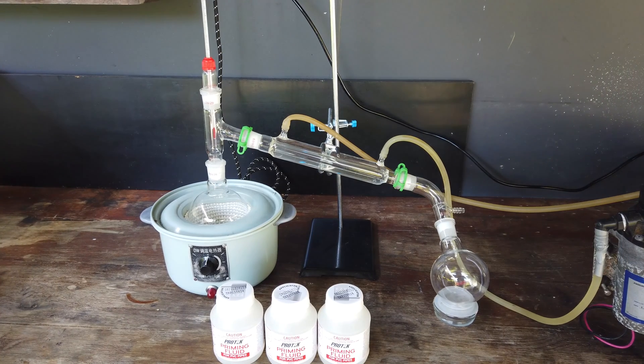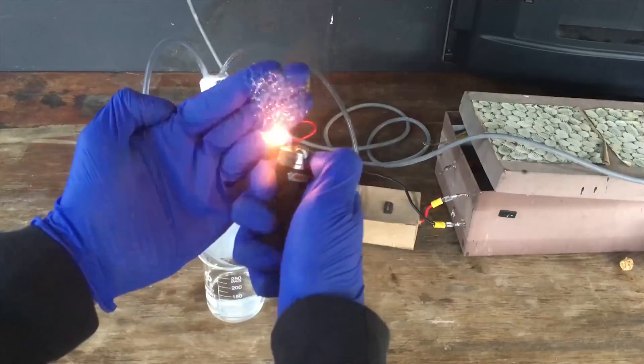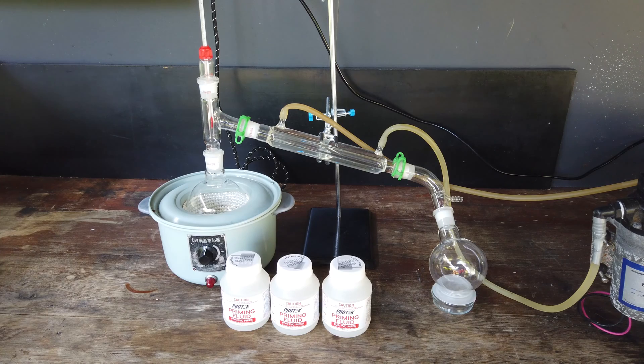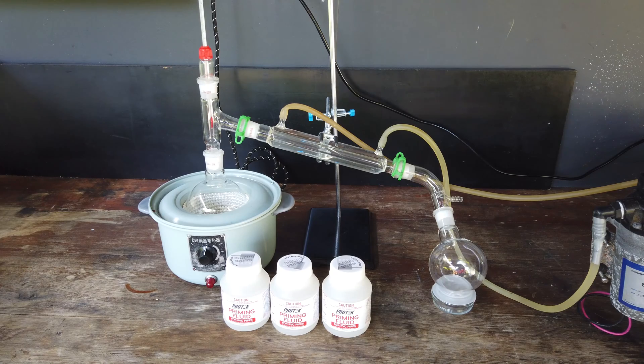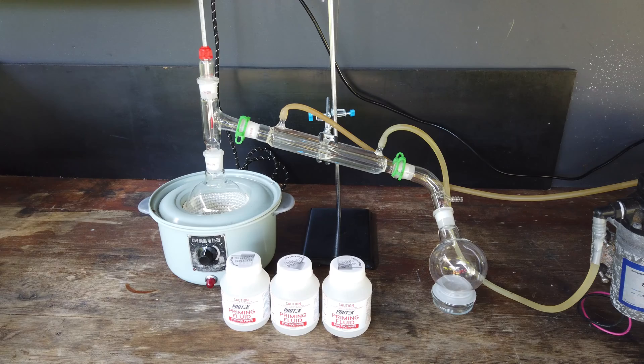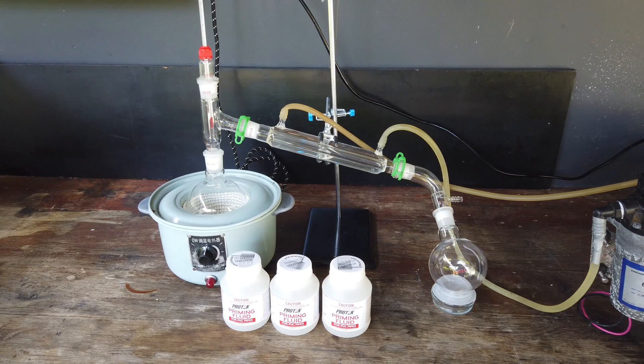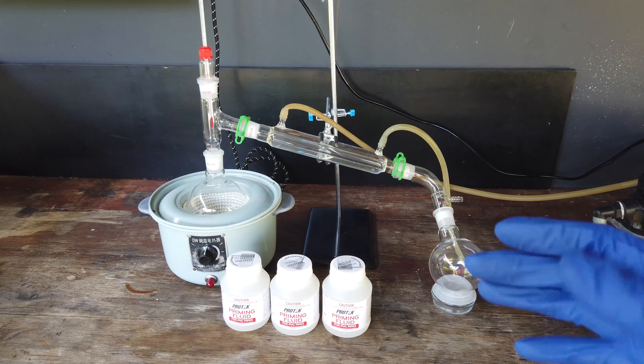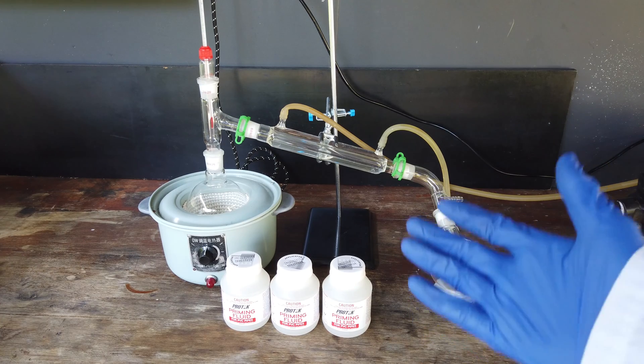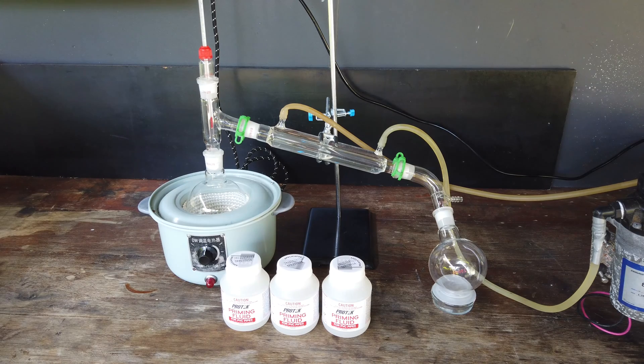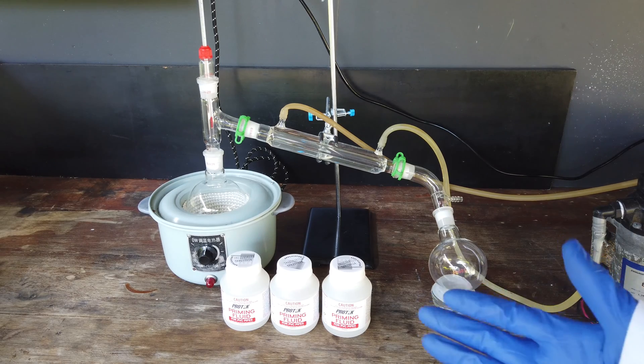Hello everyone, Harry here. Welcome to Scrap Science. I'm making this video today because I need some methyl ethyl ketone, or butanone, for a future video. Methyl ethyl ketone is a somewhat obscure solvent, not commonly sold in most hardware stores. I looked around my local hardware stores, and none of them sold it directly.